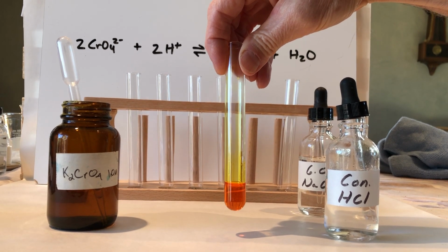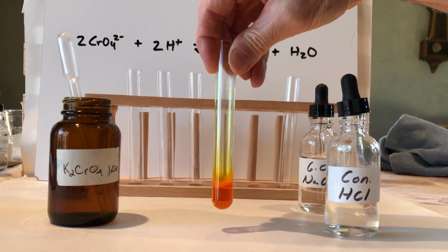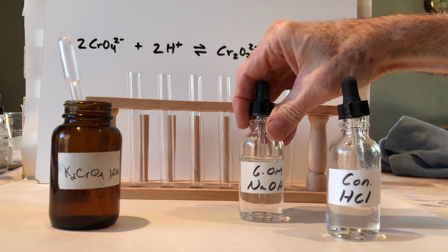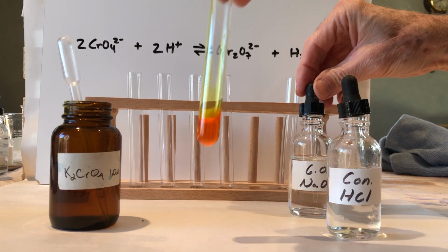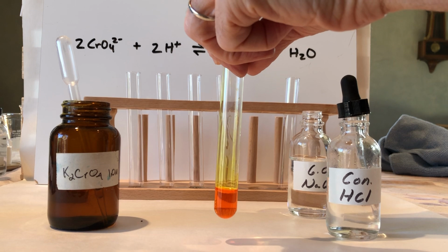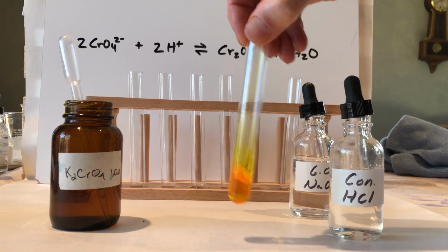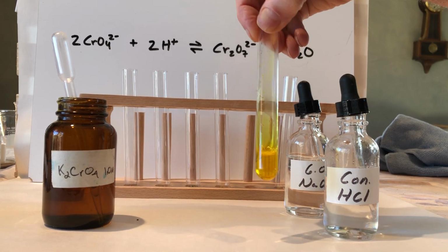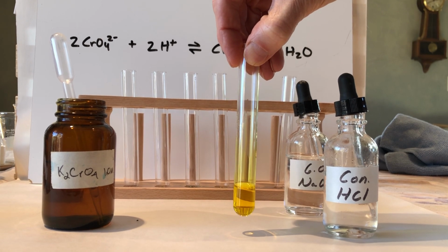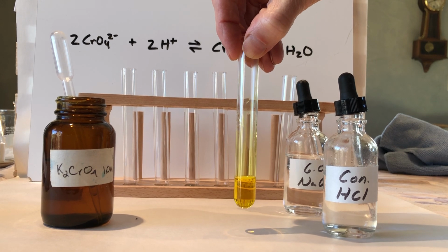Okay, so now the next thing is we've disturbed our equilibrium system. It's established a new equilibrium. It has this orange color. And now we will disturb it again, this time by adding some sodium hydroxide. So we'll add some sodium hydroxide, 1, 2, 3, 4, 5 drops. We'll see if that was enough to do anything. And yep, it looks like we have changed our equilibrium system again. So again, make your observations and explain what it means.